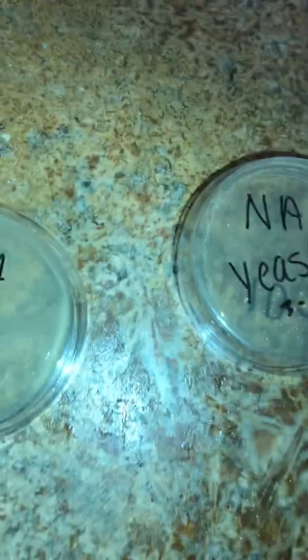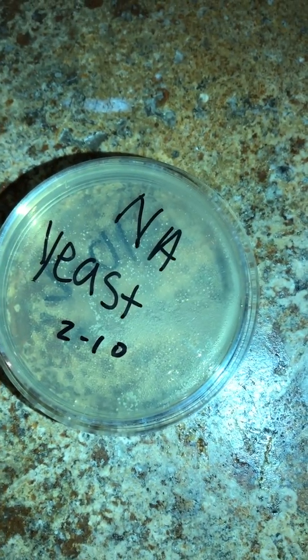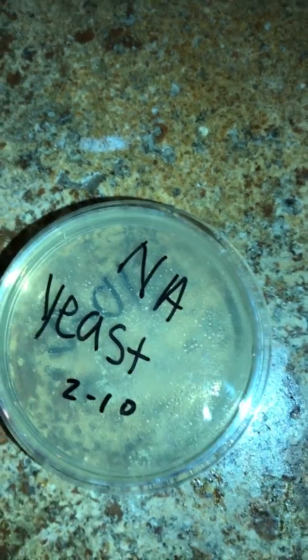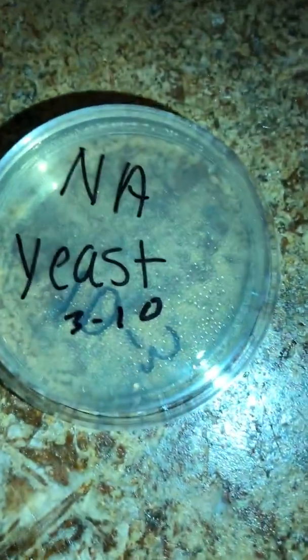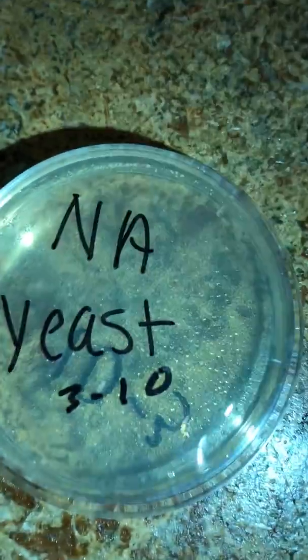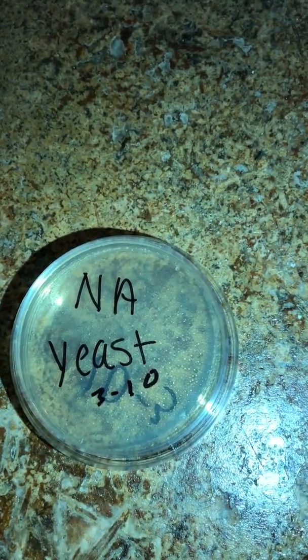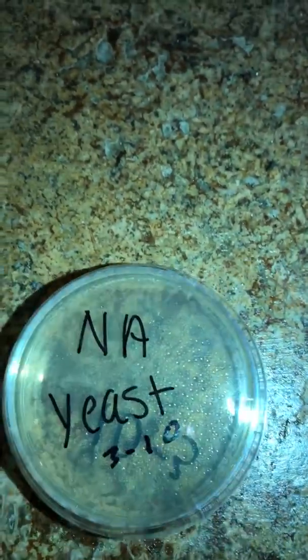And then specimen 2, that one also has a really large amount of specimen, the S. cerevisiae, that I would not be able to calculate. It's just way too many. This one is less. There's a little steam or something on the glass, so don't count those, but they kind of got spread in the corner. I don't know if you can see that. But it's still too many to count, so I wouldn't consider that a viable specimen.